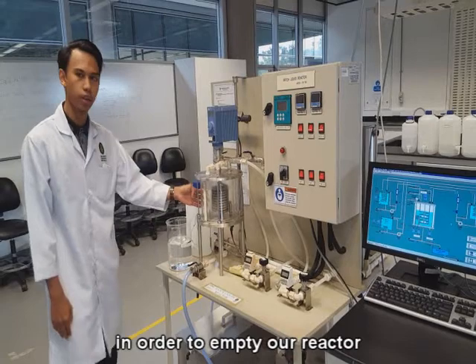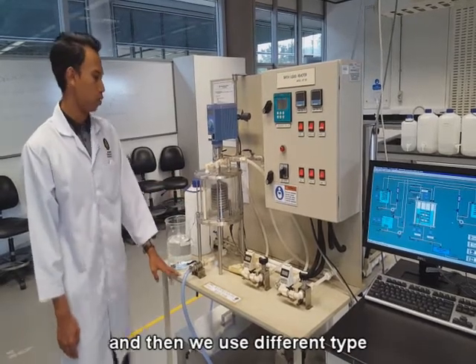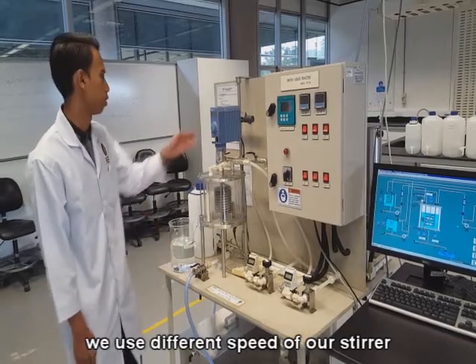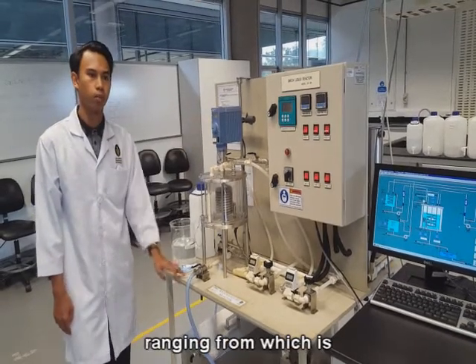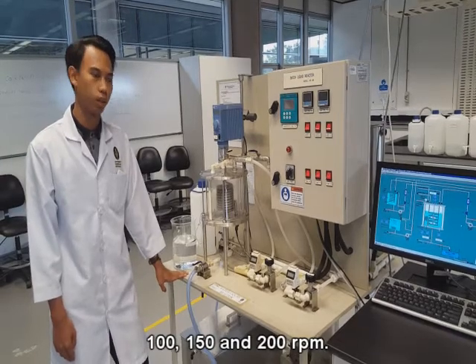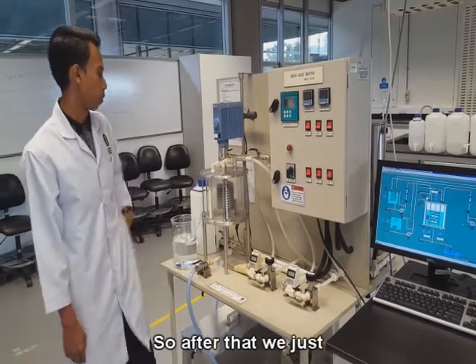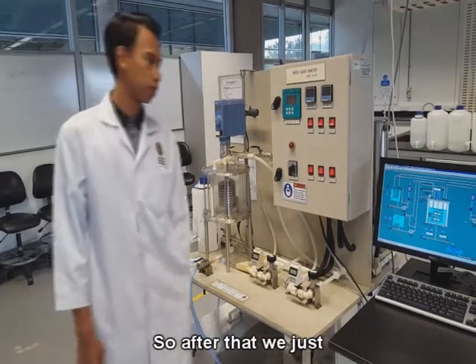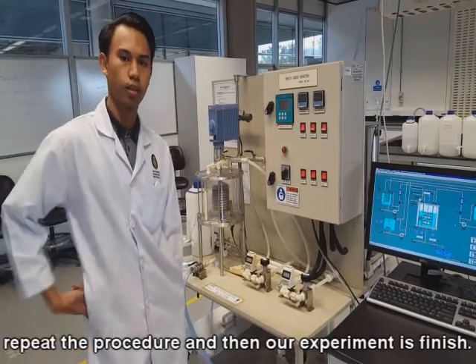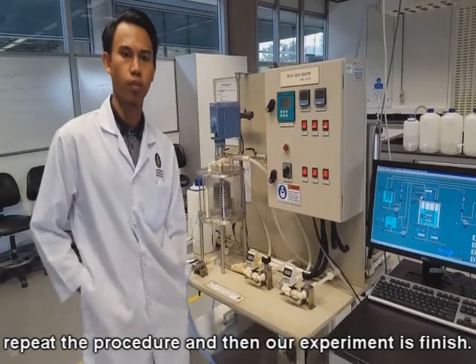Once we finish collecting the data, we open the valve in order to empty our reactor, and then we use different speeds of our stirrer, ranging from 100, 150 and 200 RPM. After that, we just repeat the procedure, and then our experiment is finished.